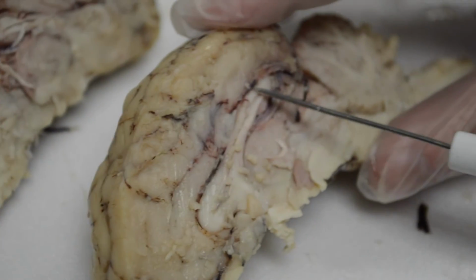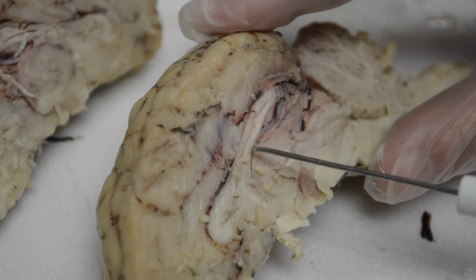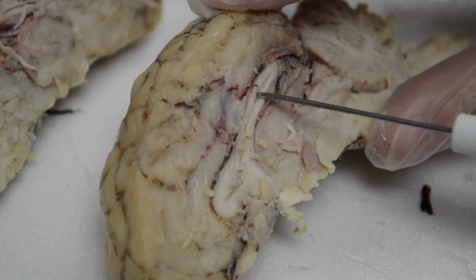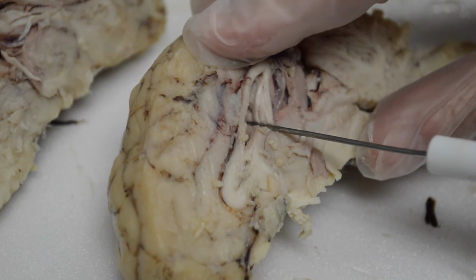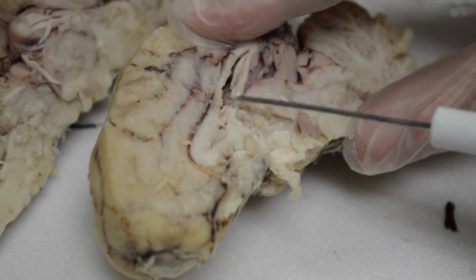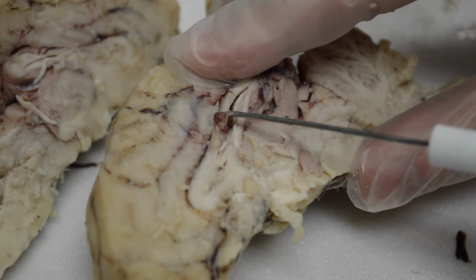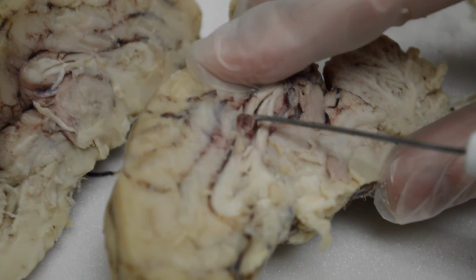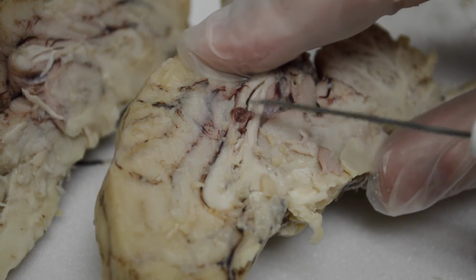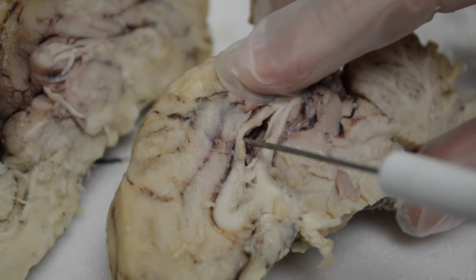Okay, so we have two ventricles on the top. There are 4 total ventricles that make and then help to circulate cerebrospinal fluid. So the 2 at the top, right here is one on this half that we've cut. And there are little cells. See the purple there? That's blood vessels. Oh, there's a nice blood vessel, like the capillaries, and our little ependymal cells are attached there, and they filter the blood and make the cerebrospinal fluid from it. So they're up in there on the roof of the lateral ventricle.